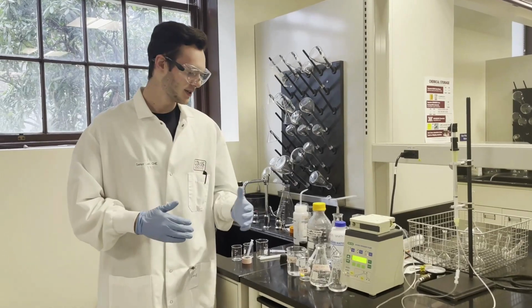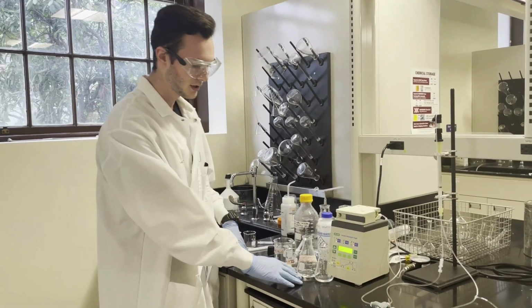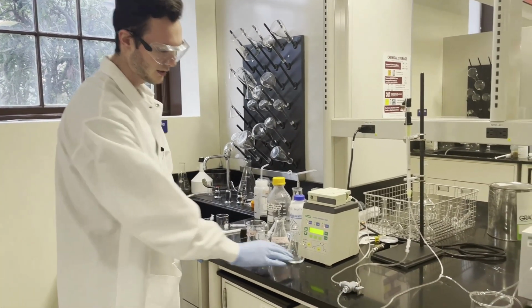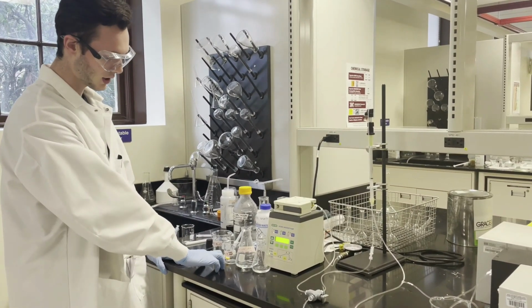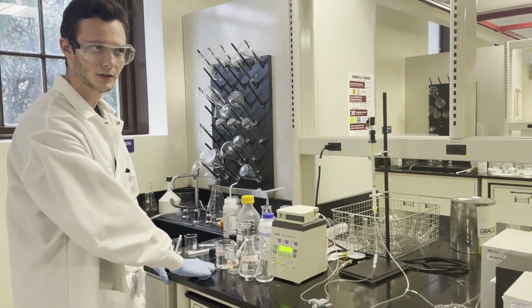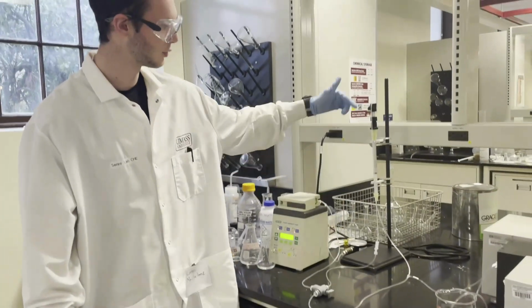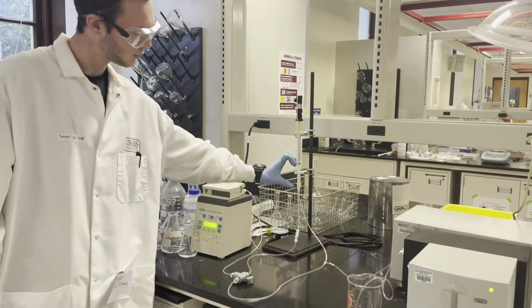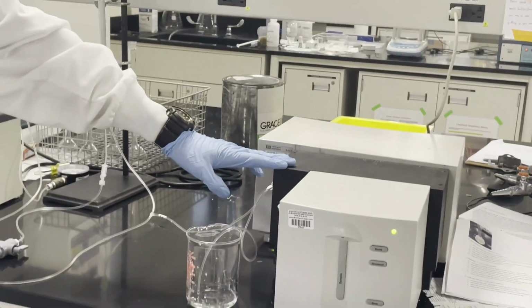All right, now we're down here in lab and we're going to go through what this experiment looks like in reality. So here we've got our different solutions set up. This Erlenmeyer flask contains RO water. This contains our loading buffer. This is our protein solution, and this is our elution buffer. We're going to be using this pump to continuously pump fluid through the top of the column, down through our resin here, and out through the bottom to our UV-Vis spectrophotometer.